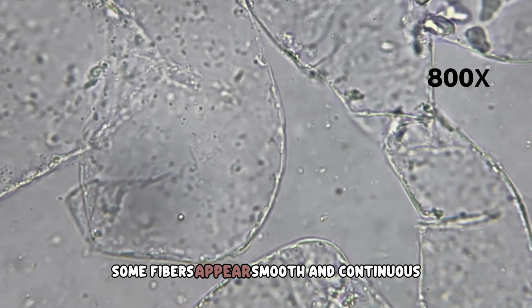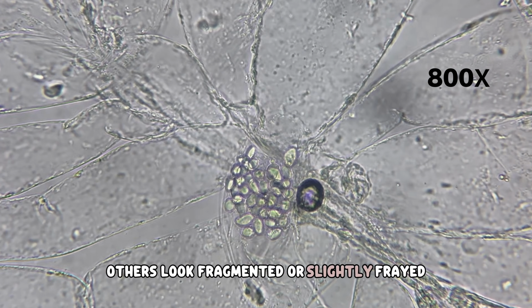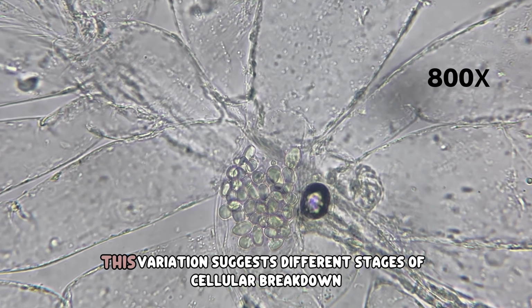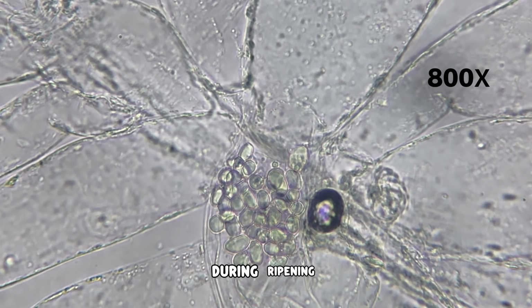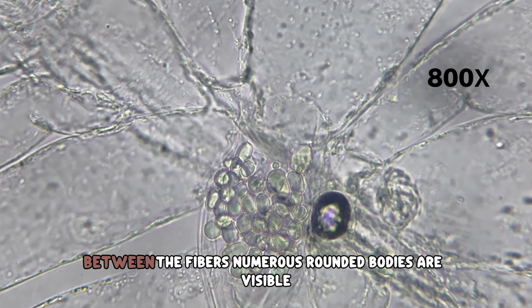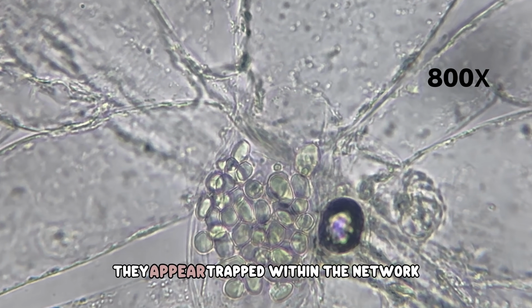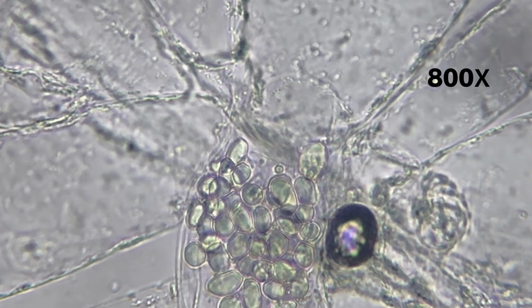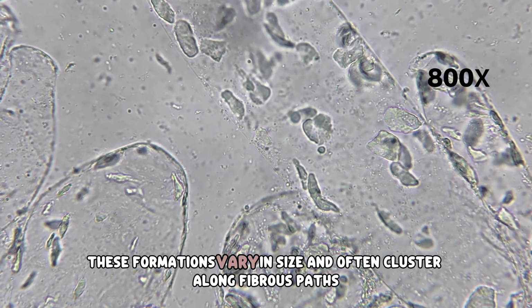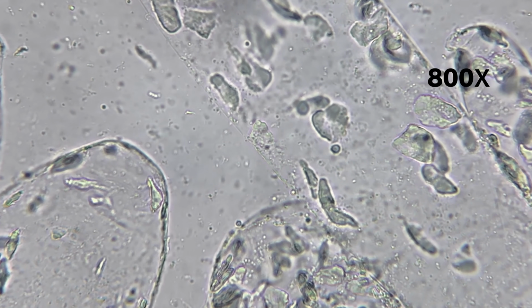Some fibers appear smooth and continuous. Others look fragmented or slightly frayed. This variation suggests different stages of cellular breakdown during ripening. Between the fibers, numerous rounded bodies are visible. They appear trapped within the network, adding depth to the structure. These formations vary in size and often cluster along fibrous paths.